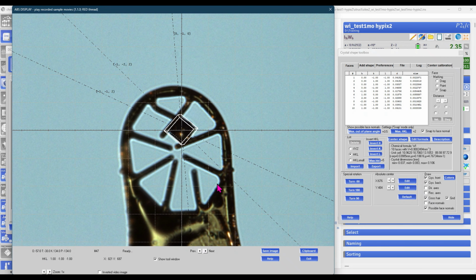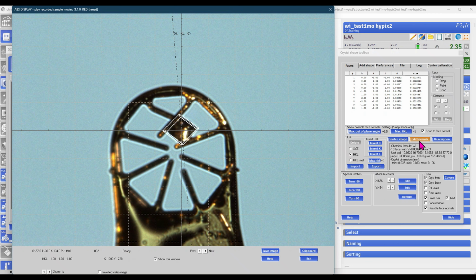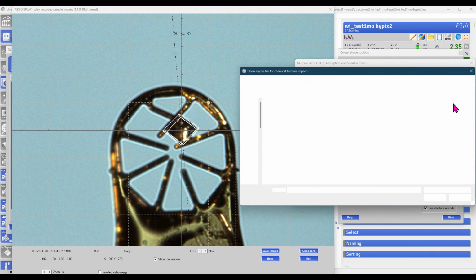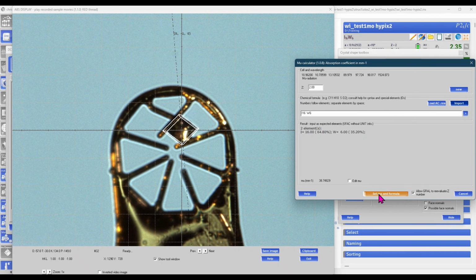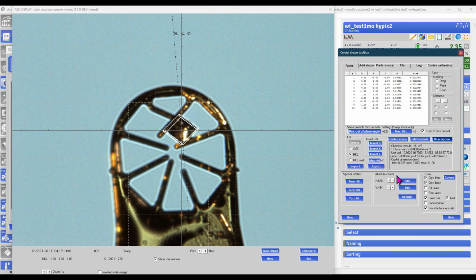After we have the shape of the crystal, we want also to feed in the chemical formula of this material. Click on Edit Formula and import the chemical formula simply from the res file. CrysAlis will read in the chemical formula, the Z factor, and calculate the absorption coefficient mu. Furthermore, we can give qualifiers, intensities, color and shape of the crystal, and Olex will read in all of this in the CIF file preparation step. Furthermore, the crystal size is calculated based on the shape that we have given.